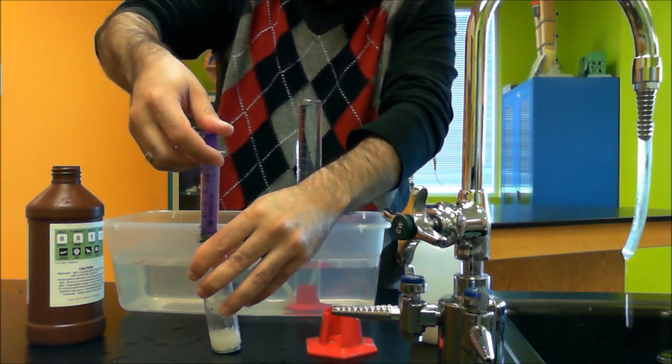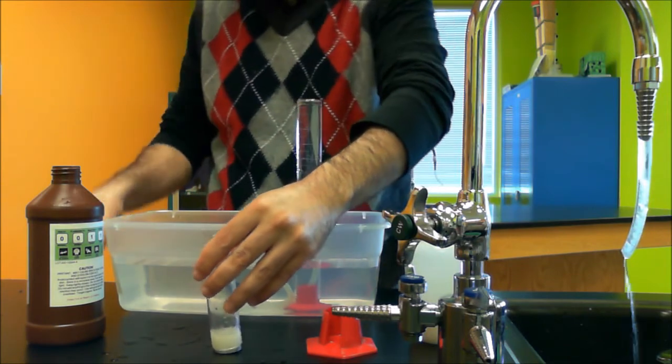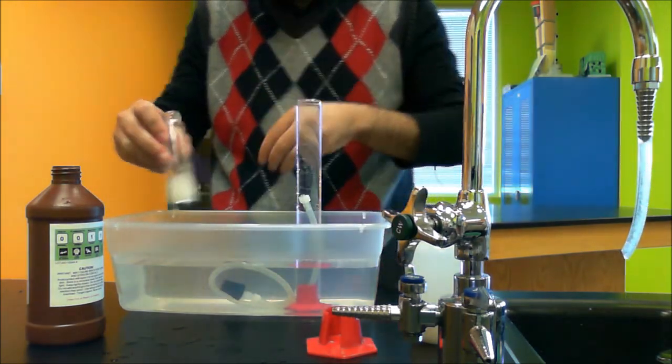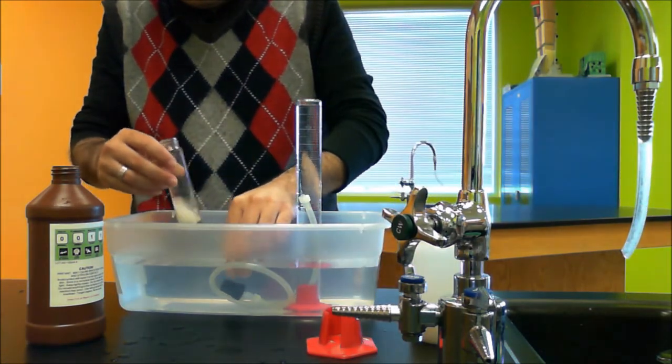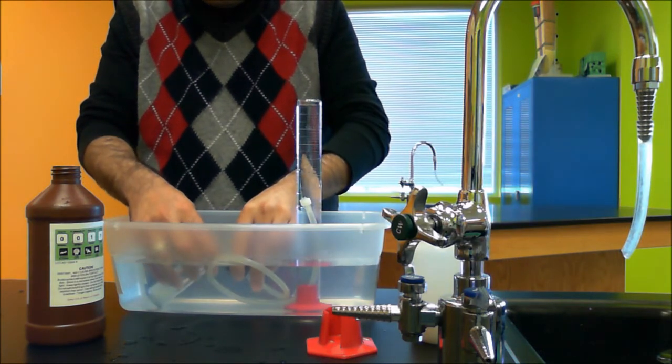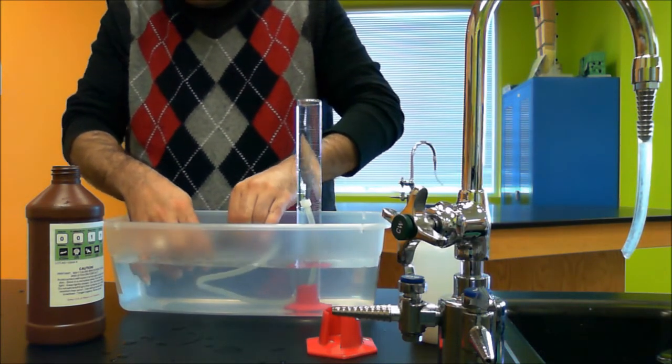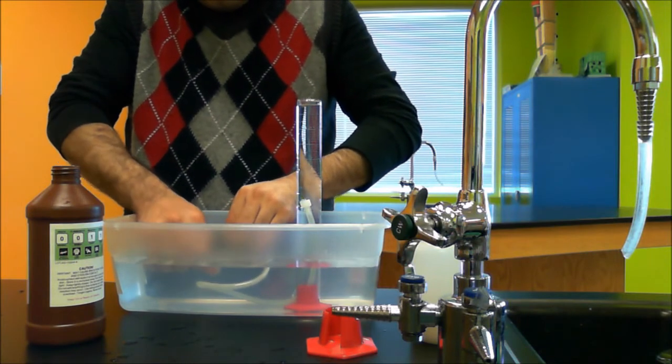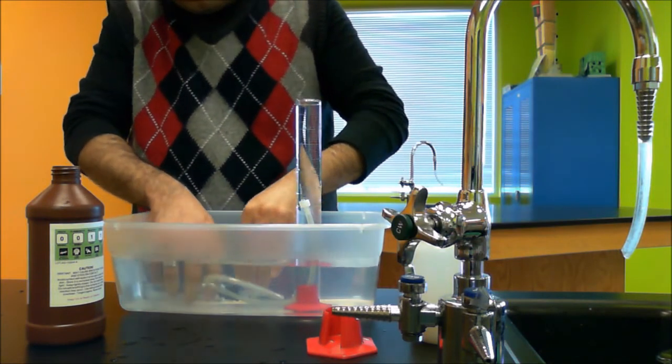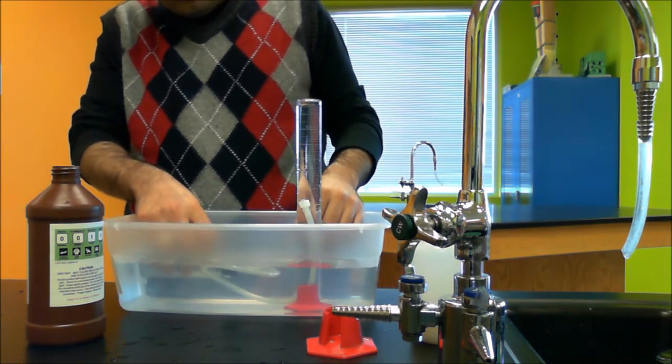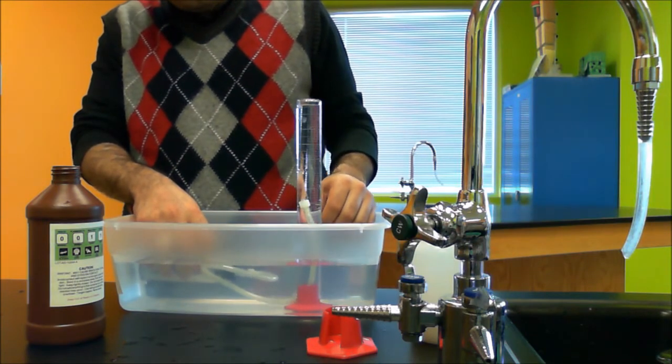Reaction will immediately start. Make sure you mix the contents nicely and insert your rubber stopper in your glass vial. Watch the reaction happening.